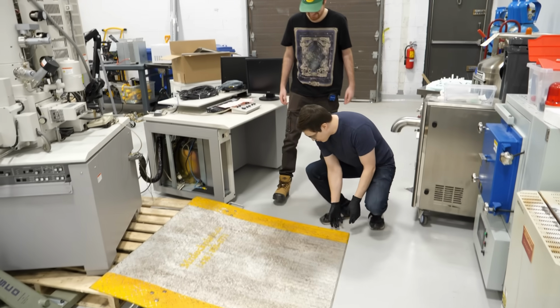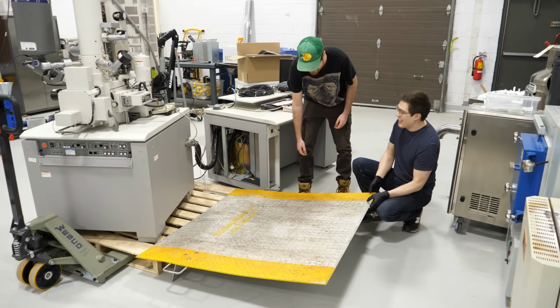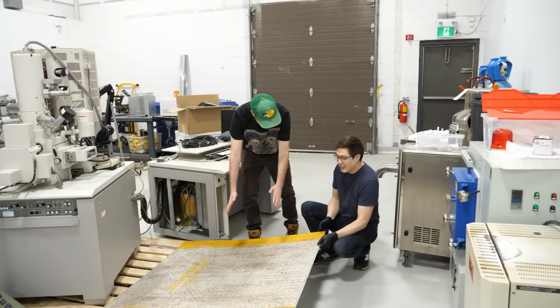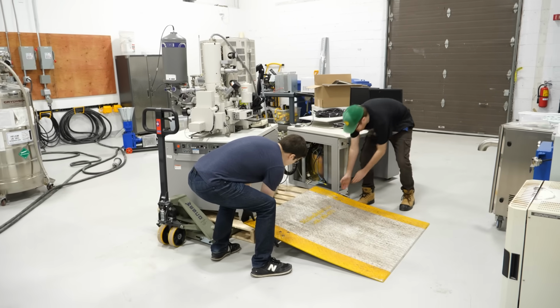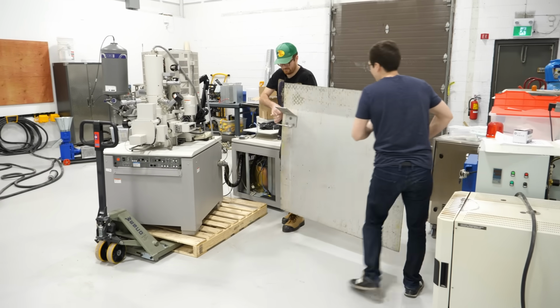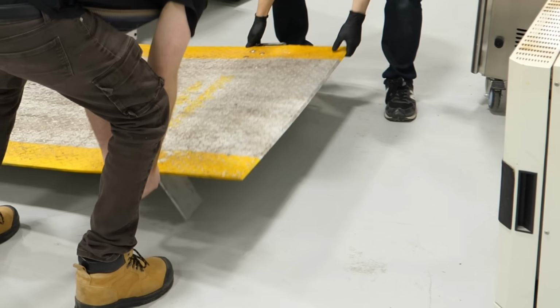What you do is under here... Yeah. You do this, and you prop this up with like a block. So this is stage one. Yeah, you block. Yes, exactly. Yeah. This is not gonna work. Yeah. Lift it with me. We'll spin it around. This is the most cursed method. And then we'll do this, right? So it's now floating.